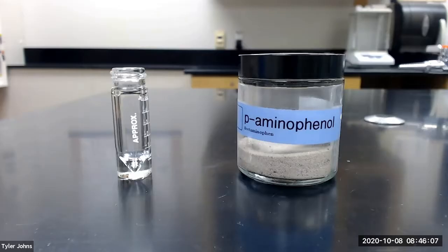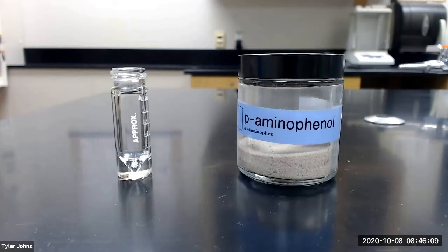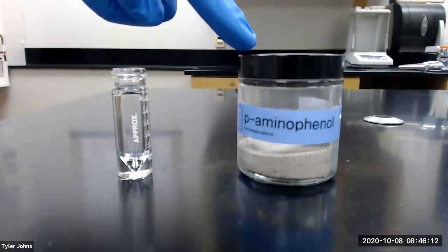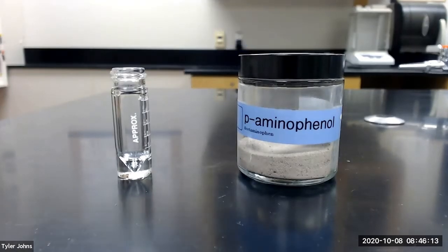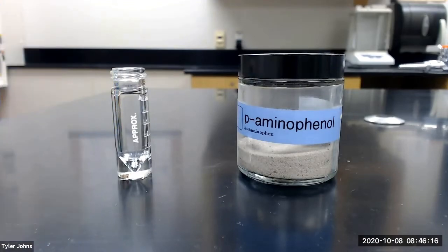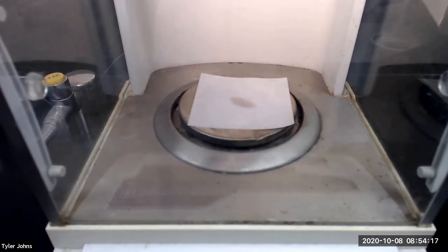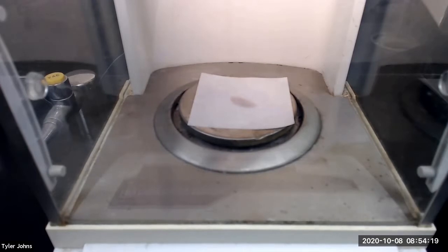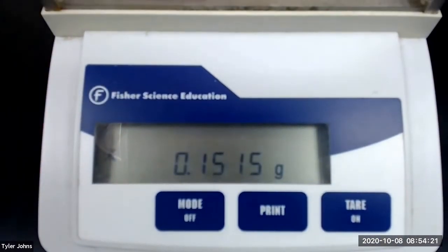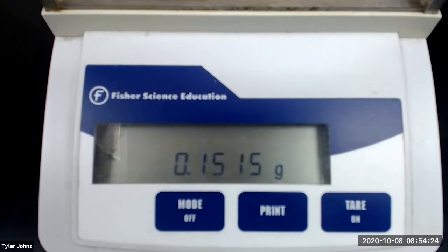The first thing we need to do is weigh out approximately 0.15 grams of P-aminophenol and transfer to a 5 milliliter conical vial. The mass of P-aminophenol that we will be using is 0.1515 grams.